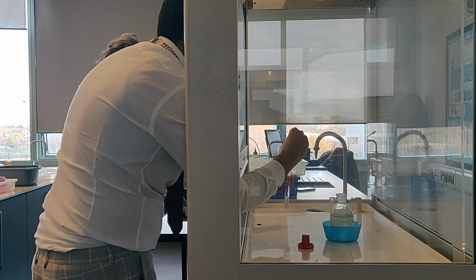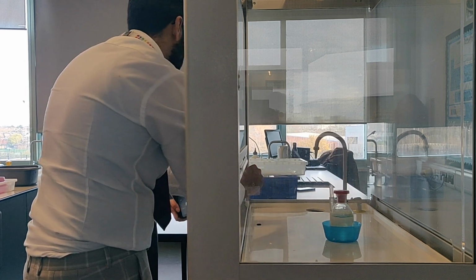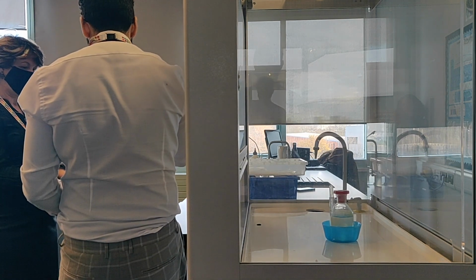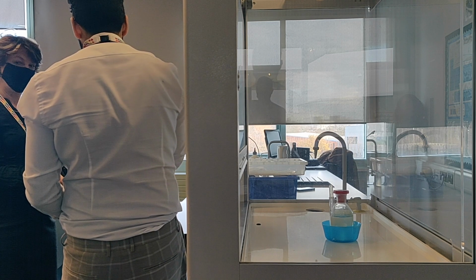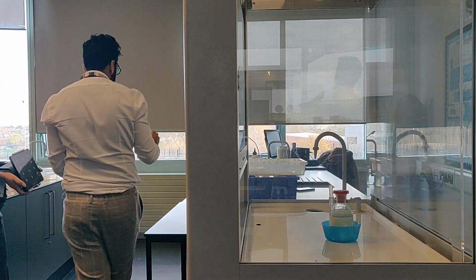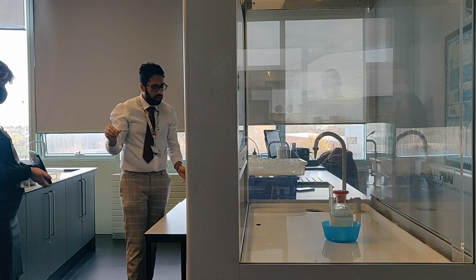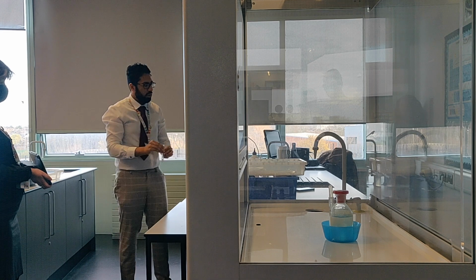You should be able to see that with the concentrated ammonia added, the top of the solution has gone clear, and the bottom of the solution has stayed green. So that's the difference between dilute and concentrated ammonia. Concentrated ends up going back to a solution, and with the dilute 2 molar one, the less concentrated one, it becomes a precipitate. Again, this gets disposed of in the sink.